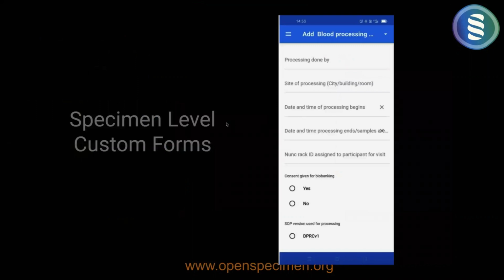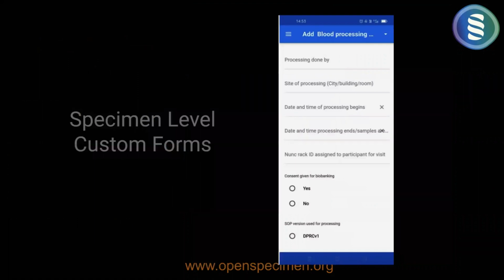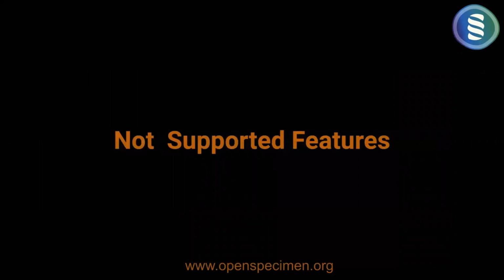Similarly, you can do collection of specimen custom forms. So you have a blood processing form, you want to collect data. Many of these lab users are doing data entry with gloves on their hands, and not standing in front of a desk where they're actively doing their work, and they want to do data entry in between that step. So it's a lot more convenient to do it. You open the form, do the data entry, save, and move on, and you can collect additional specimens, etc.